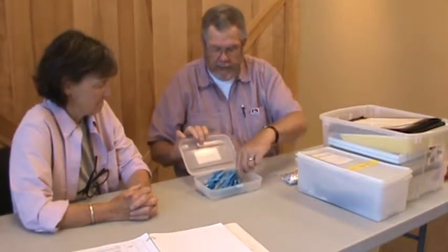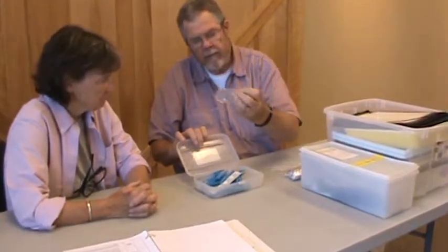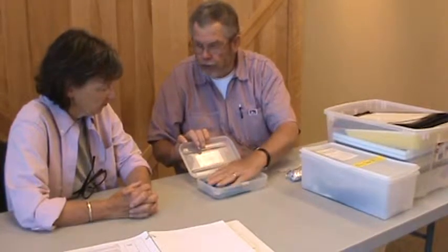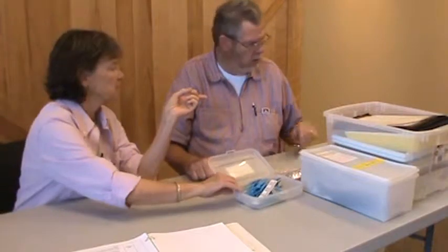Here's where it starts. This is all of the equipment we'll be using. We have a great big box, and in this box are tools — measuring rulers, a magnifying glass if you need them, and little tweezers, though we discourage their use. They get too wound up in detail if you use the tweezers. What's on top of the box is an outline of what we're doing, and that's in the manual too.